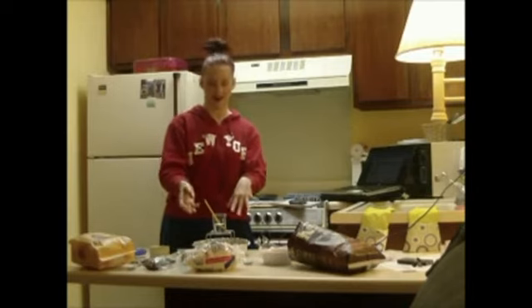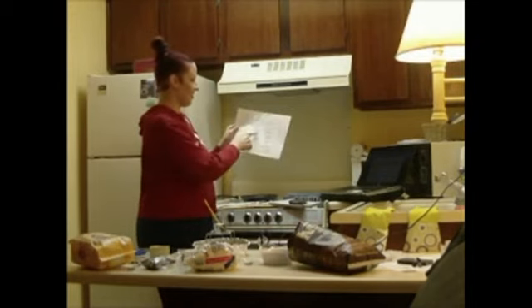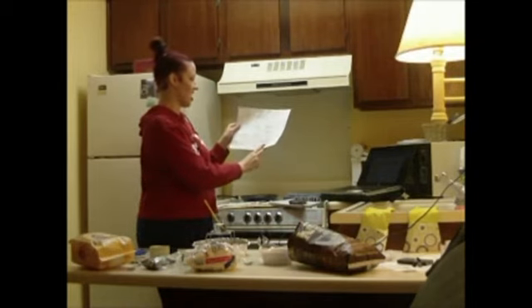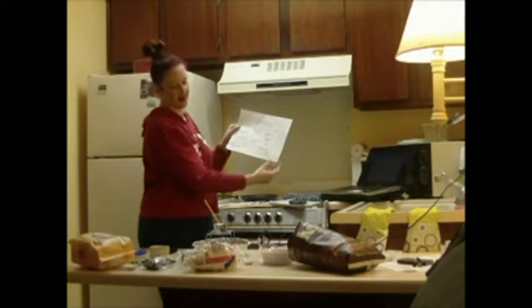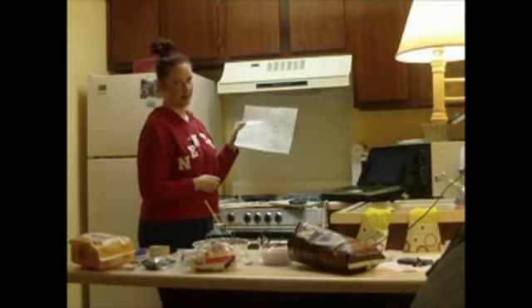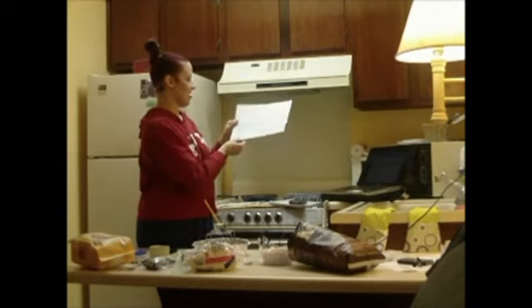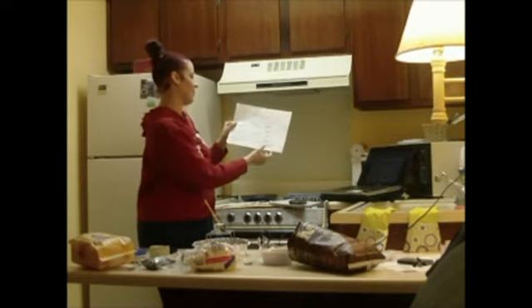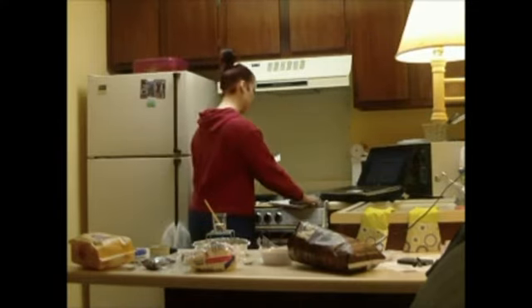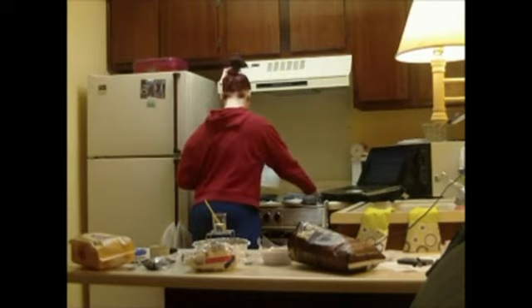measure the final temperature so that I can use this formula, since I know the mass, I know the specific heat of water, and I'm just going to need the temperature difference between the final, what it heats up to, minus the initial, and I'll be able to calculate the heat energy in joules. The specific heat of water, where did my Sharpie go?